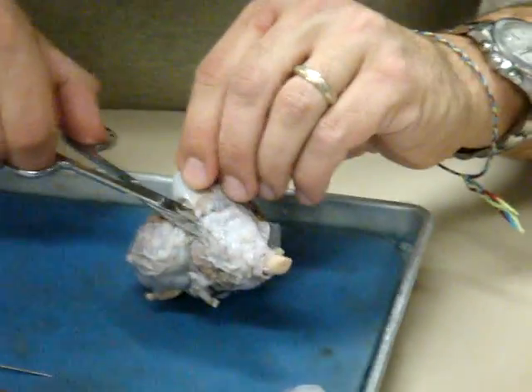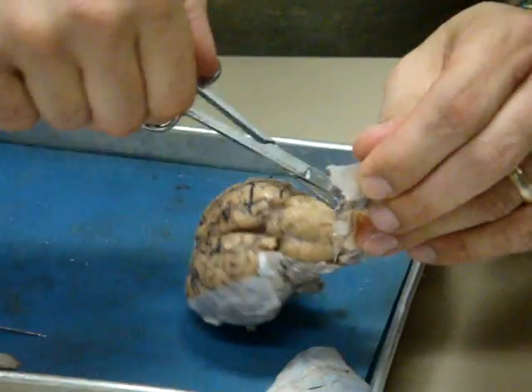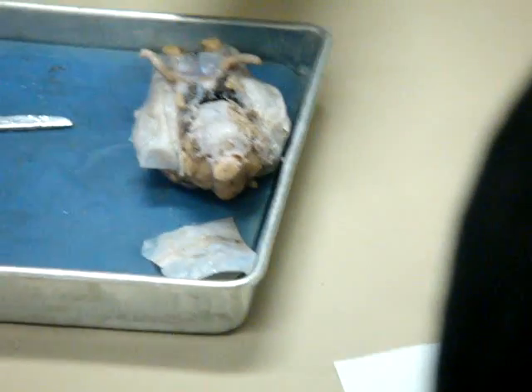Removing the surface here from the cerebellum. Let's go all the way down to the brainstem here. This is the spinal cord actually, but I'm removing it from here. And, okay, I'll clean it up a little later. But I'm just going to cut that. Now I can see, I did have a little cut there, that doesn't feel good.